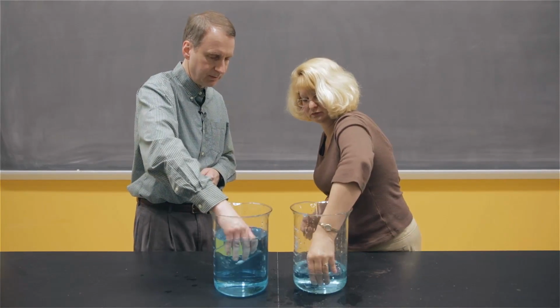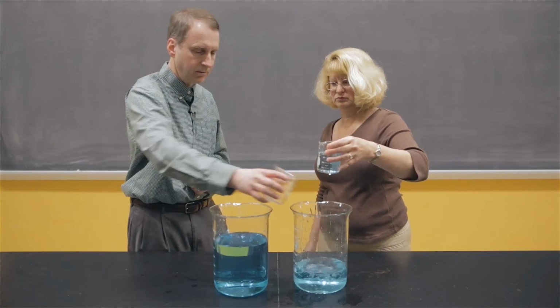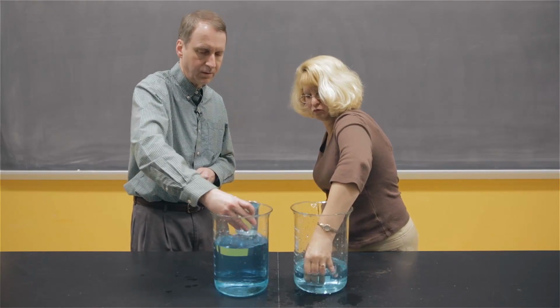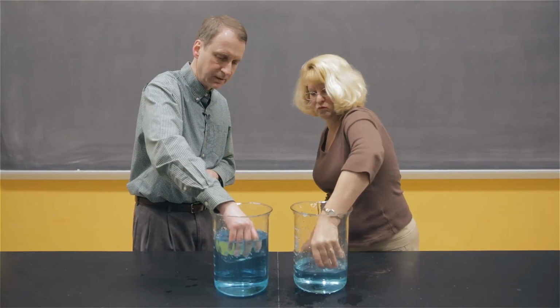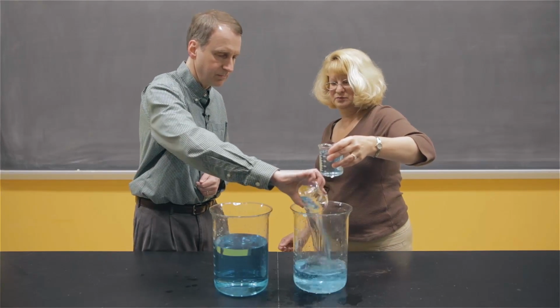Now, how are you doing? You getting a full beaker? Not quite. We're getting close, okay. Mine's full, yours is almost full. Let's keep going a little bit farther. We're getting close.